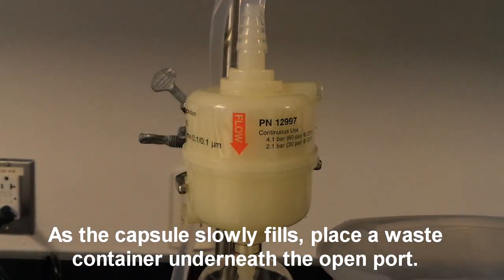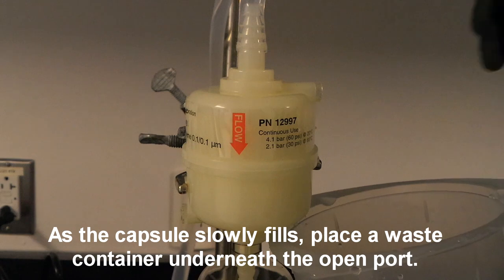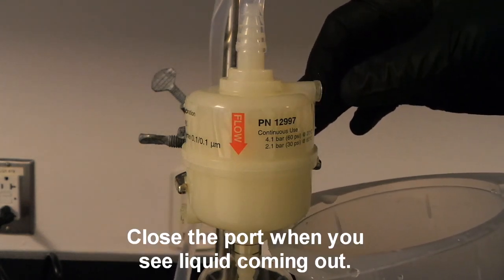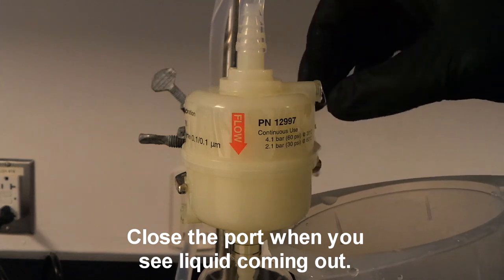As the capsule slowly fills, place a waste container underneath the open port, and close the port when you see liquid coming out.